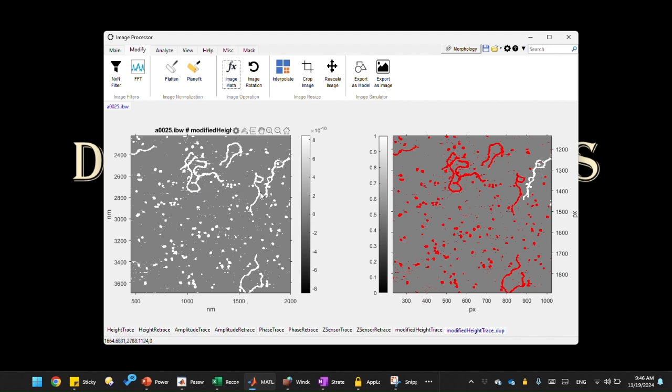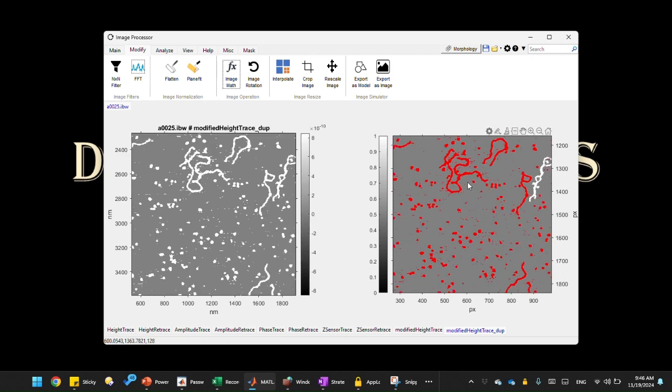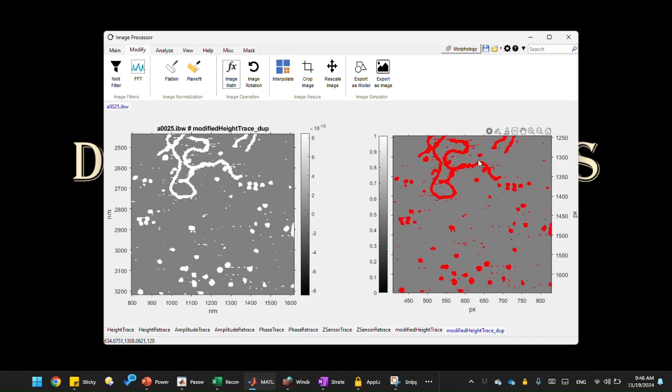This is the image that we just created, but as you see, everything on the DNA is highlighted, and we don't want the whole DNA or these free proteins. We only want the protein DNA complex, a part of that, for our particle analysis. For example, we don't need something like within this box. We don't need the whole thing. To do that, I need to use another technique that I discussed in another video, which is a custom script that automatically selects the protein DNA complex for us. It's a custom morphology script.